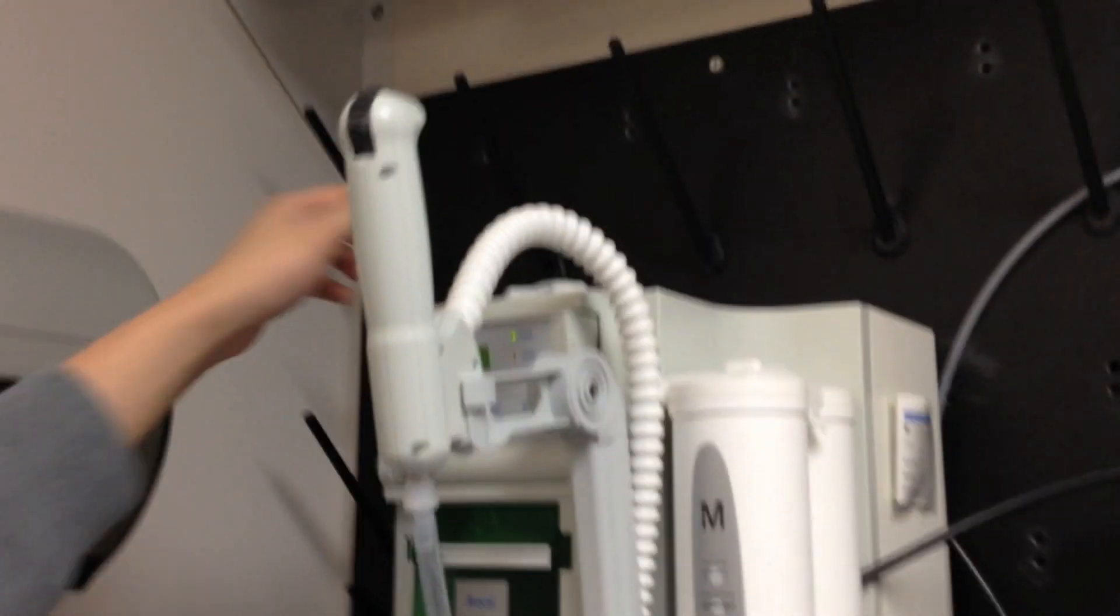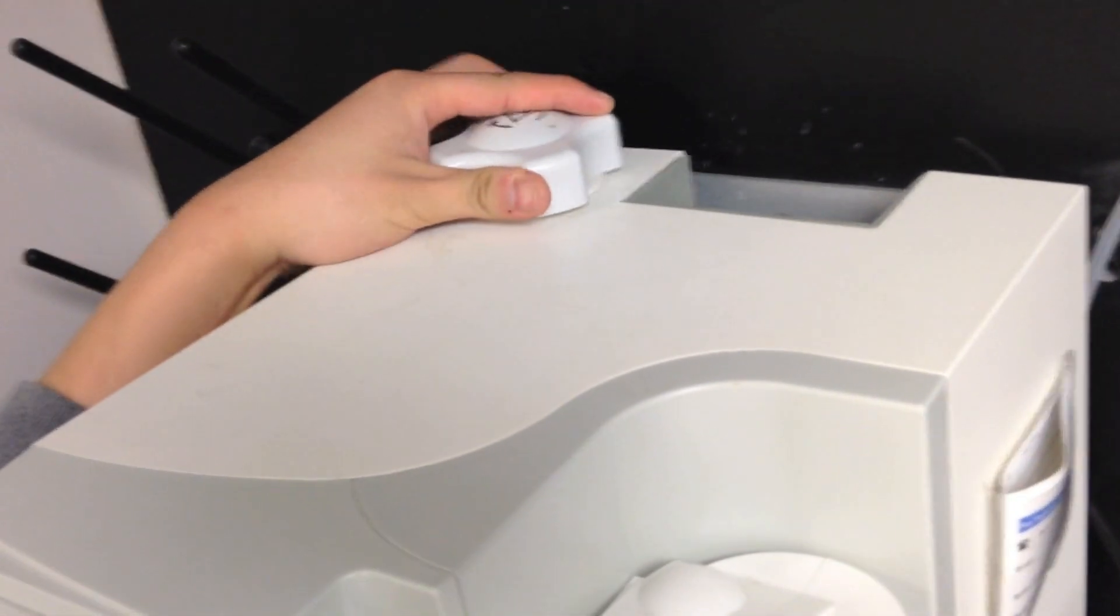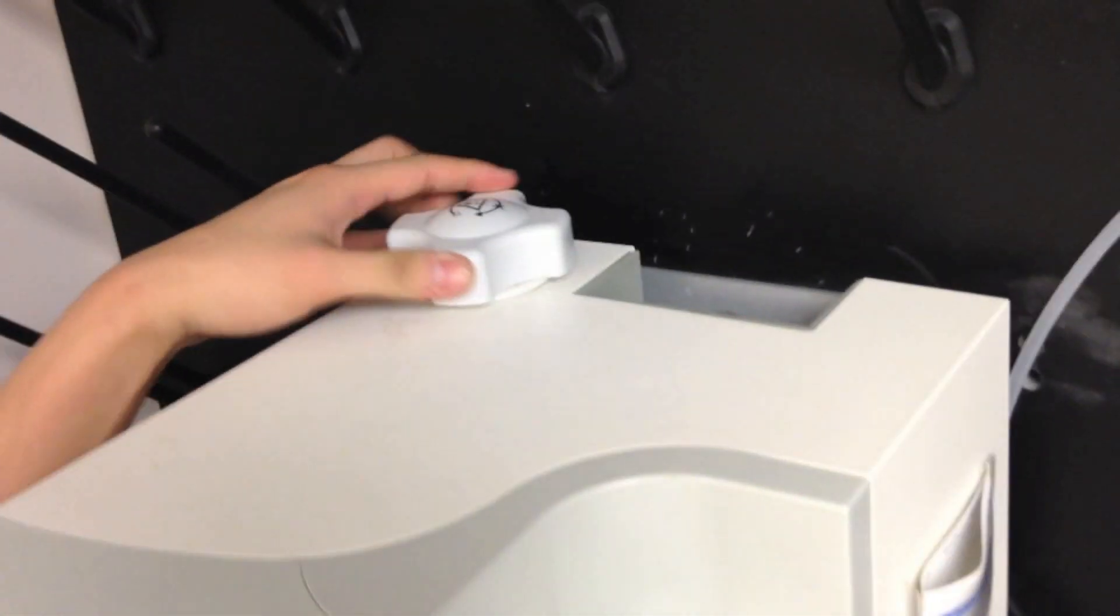Now what you will need is this thing to open the cap back.